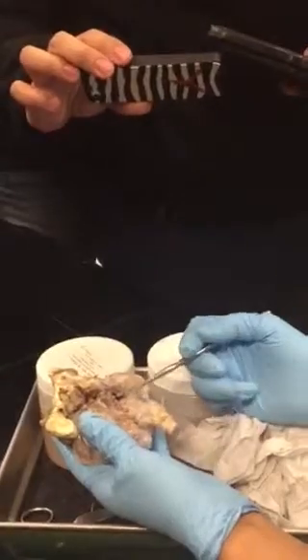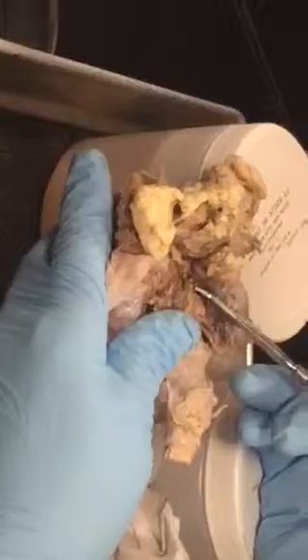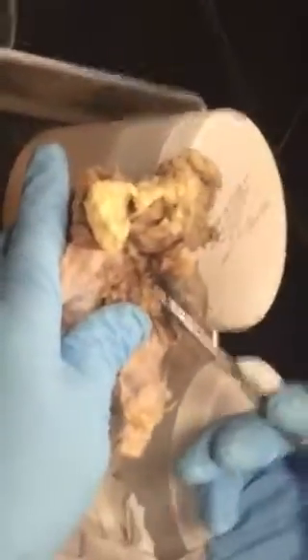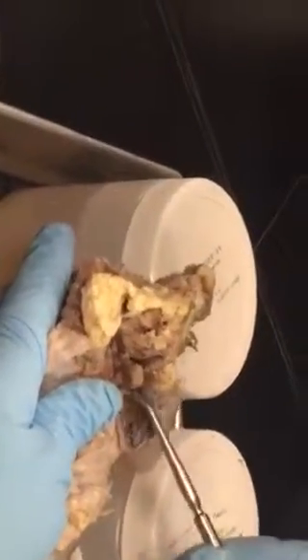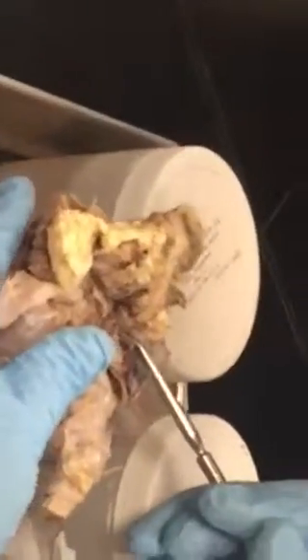Landmark pons here. The pituitary gland on this sheep brain is damaged. It's actually only half is here. Do you see this? It's like half a peanut being cut this way. This is the dorsal half of the pituitary gland. It's supposed to be jetting out, right? Yeah, it's already jetting out. But you can leave it, or you can take it off. Underneath that, you can see the mammillary body. Does it make sense so far?